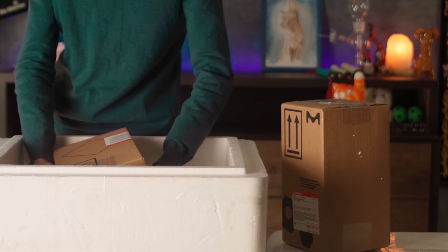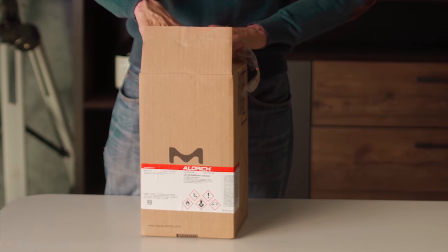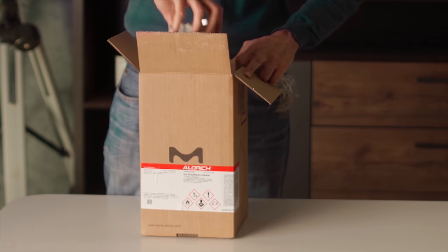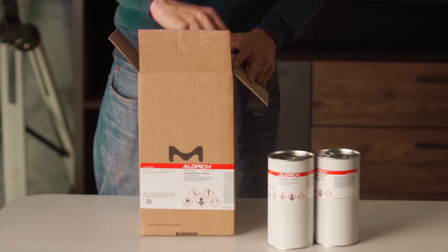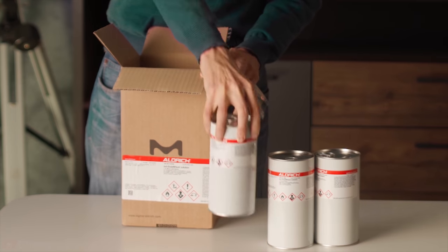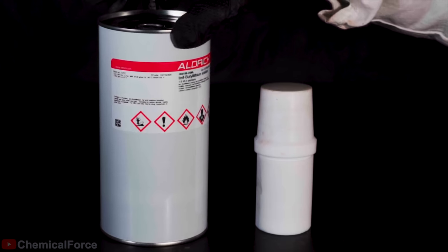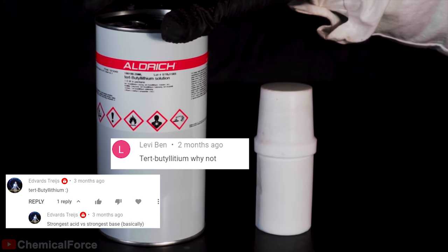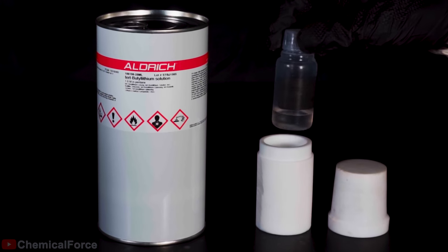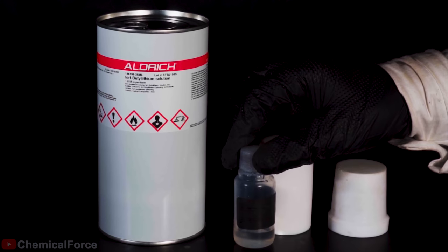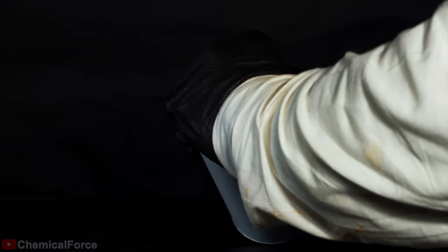This box contains a very strong base, tert-butyl lithium. And as you might notice, it's also packed into cans. One, two, three, and four. Well guys, now we'll try to add a very strong base to a very strong acid. Tert-butyl lithium is a pyrophoric substance, and I'll show you how extremely dangerous it is in a separate video. But for now, let's take our reagent out of the can.